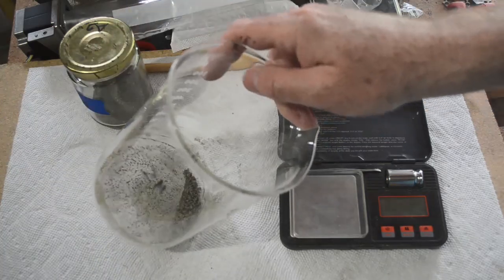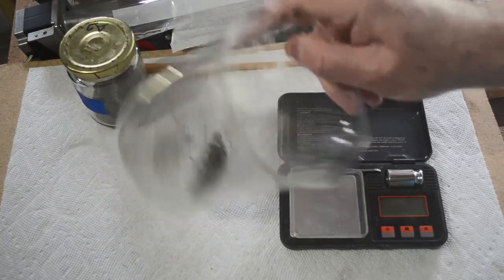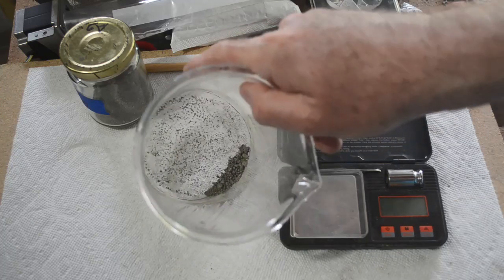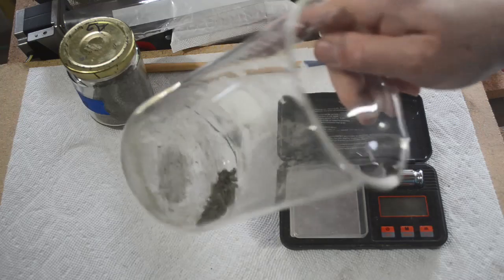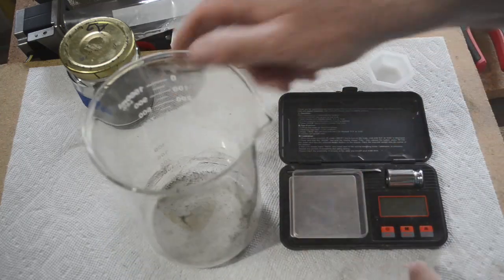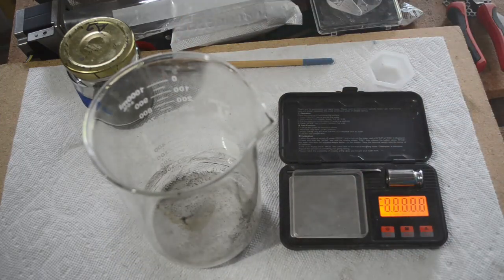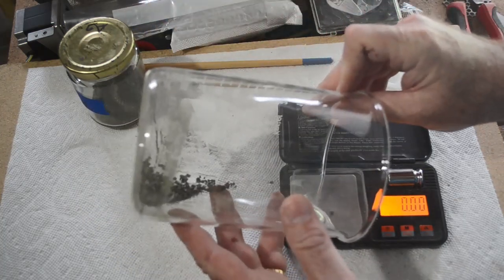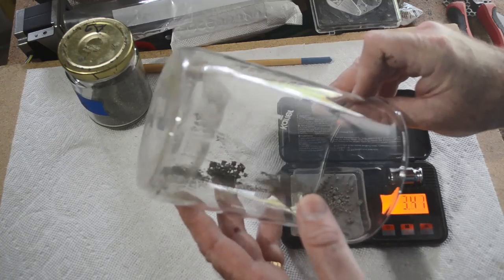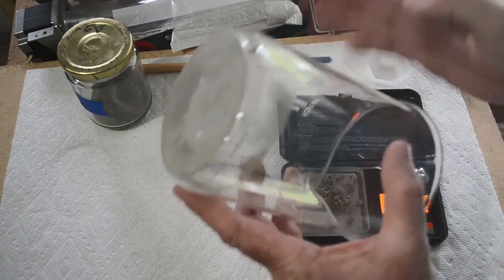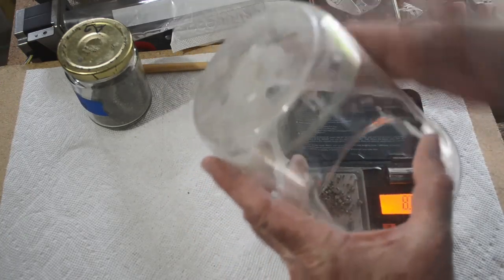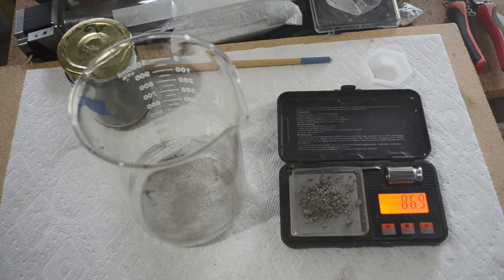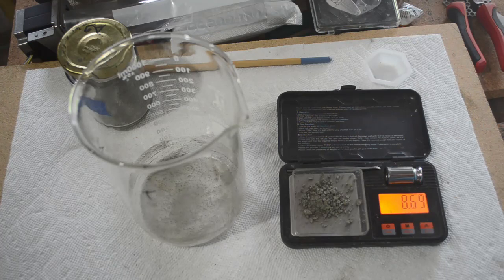Okay, silver's all dried up. Kind of dried up, got a little bit chunky, and there's a lot of it stuck to the inside of the beaker too, but I don't think there's enough of it to affect the weight really. So let's see just how much silver we got using this method. I kind of got distracted and left this on high heat for a while, so it really consolidated and chunkified as it dried out. 8.69 grams. Okay, not too shabby.